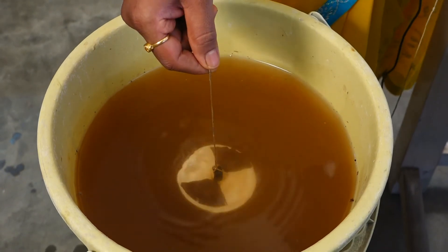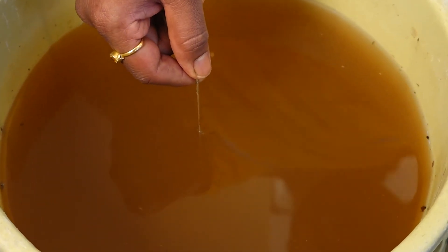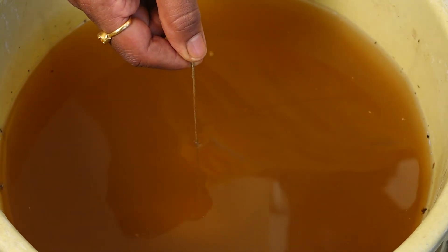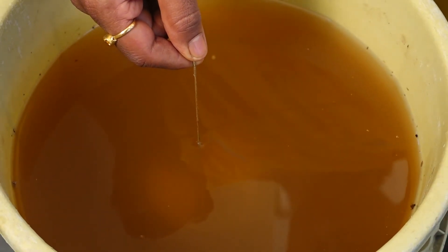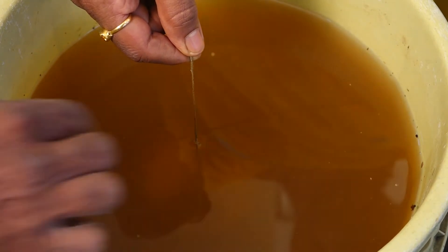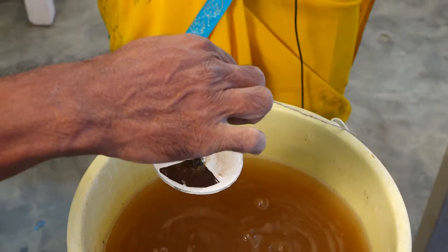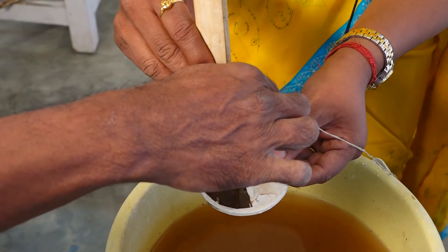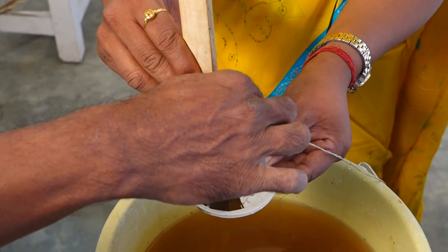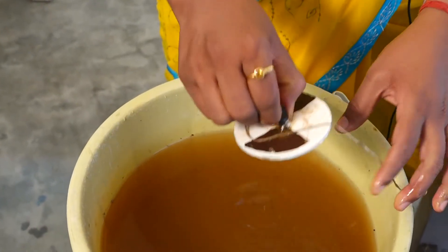Now I am dipping it again. At a particular point, I am not able to see the Secchi disc. Now slowly I pull the rope up. At this particular point, I am able to see the Secchi disc clearly. Let me note the distance at which I was able to look at the Secchi disc clearly — it happens to be 8 centimeters.